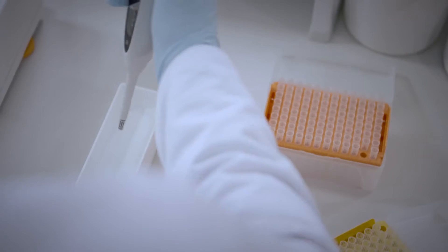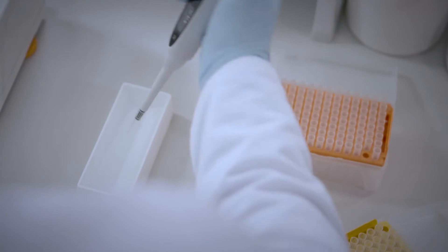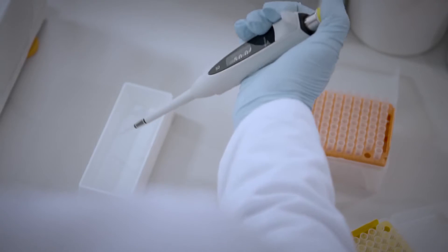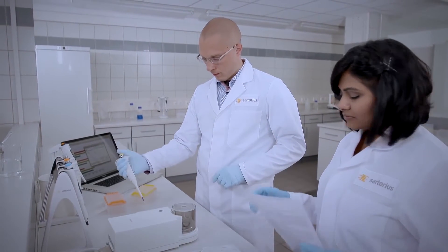It's important to maintain a stable, draft-free environment for pipette calibration with a constant temperature and humidity. Always follow the same procedures to maintain best results for calibration.